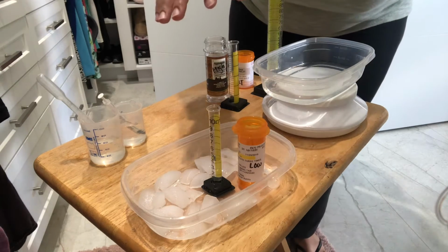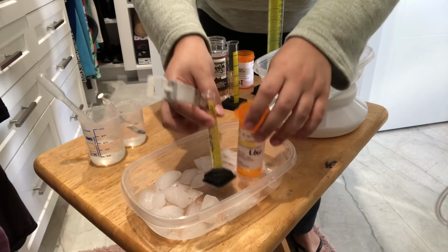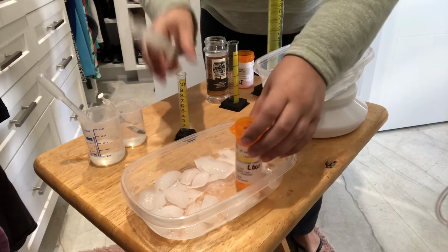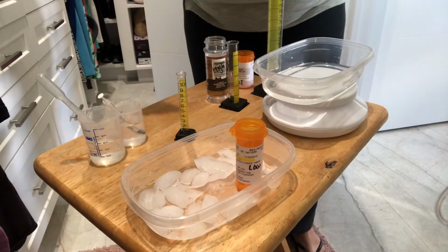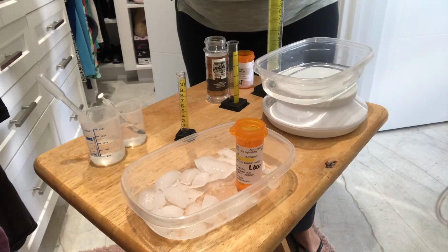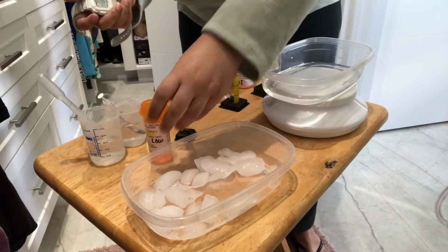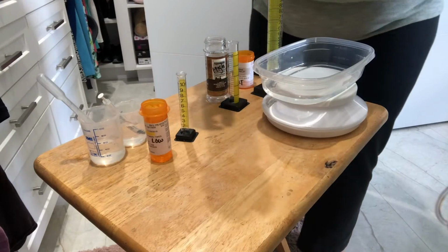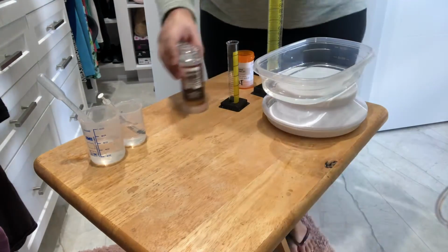We want to have the timer handy, because immediately after we take the tubes out, we're going to pour our hydrochloric acid into our sodium thiosulfate, and we're going to press the timer. We're going to stop our timer once our precipitate of sulfur, which will be yellow, forms. And so that concludes our ice bath. We can just move that out of the way, and then we can move on with our hot bath.